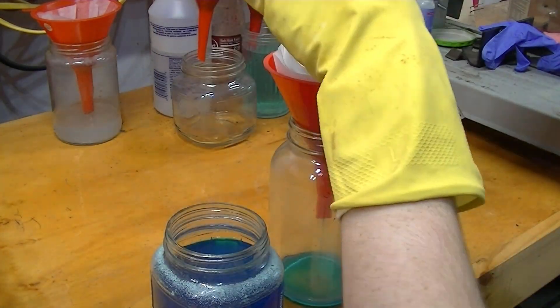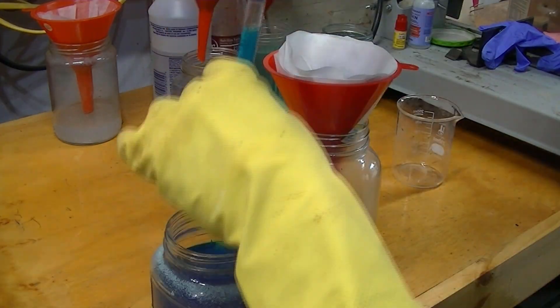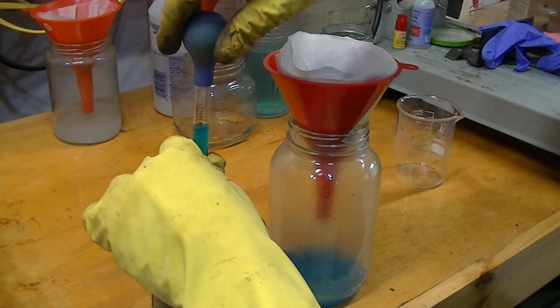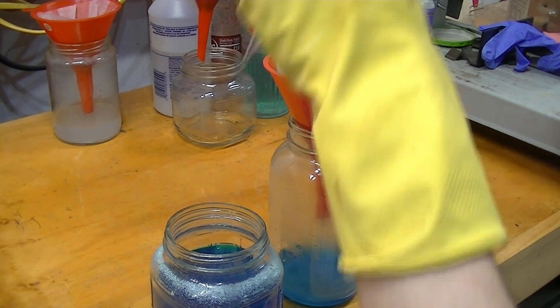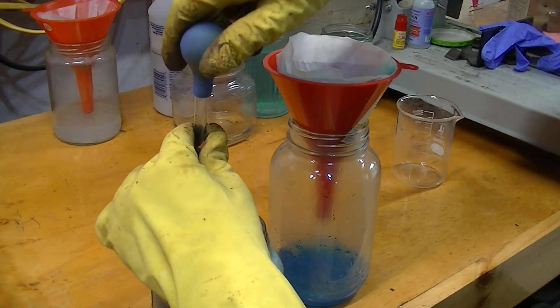Now, it's time to take the solution out of the jar and we have to run it through some filters, to make sure we catch all the silver precipitate that comes out.